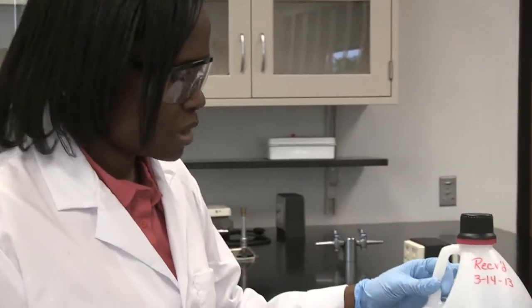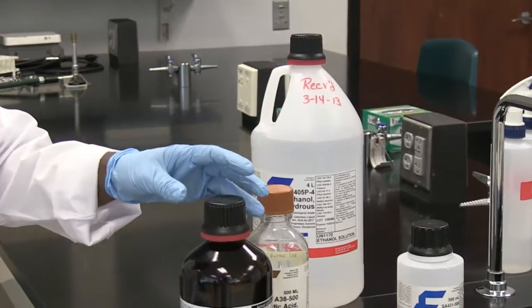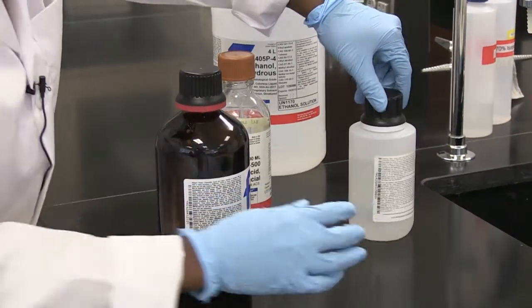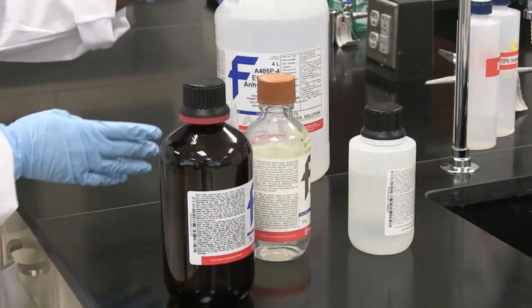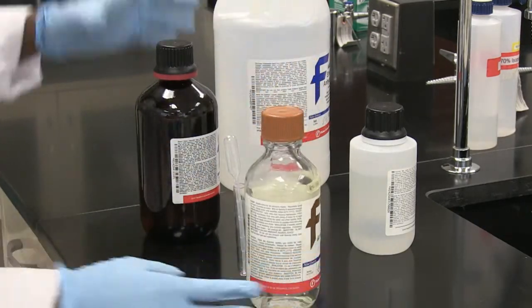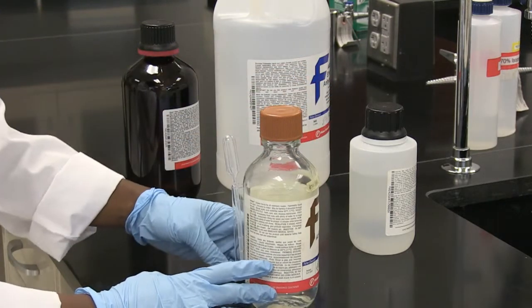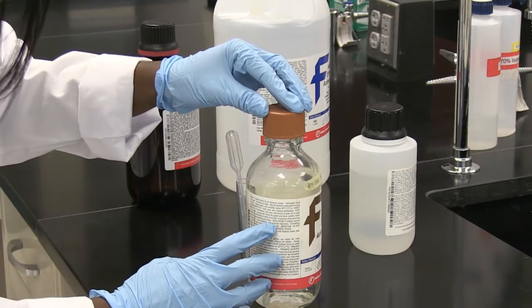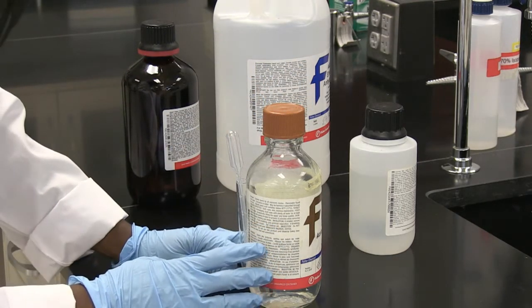Always make sure before you handle any of these chemicals that you read the labels properly. The labels for these chemicals are located on the front. Looking at acetic acid as an example — it is an acid, so it is very corrosive and could cause extreme burns. You have to be very careful when handling it.